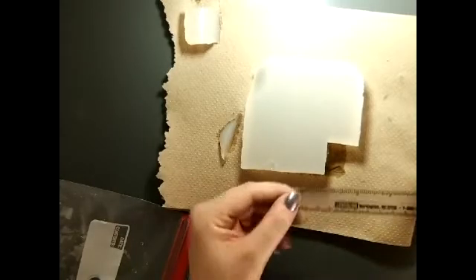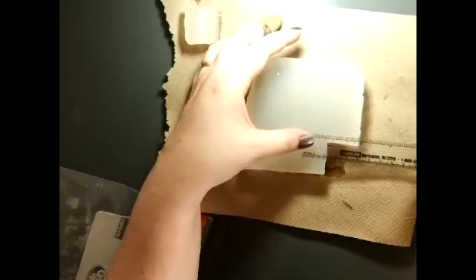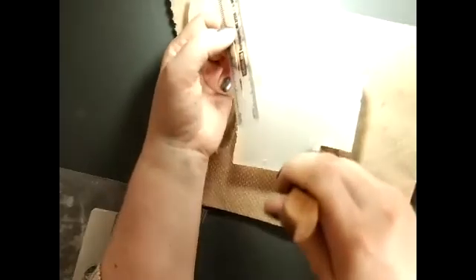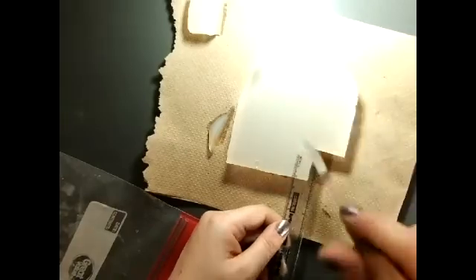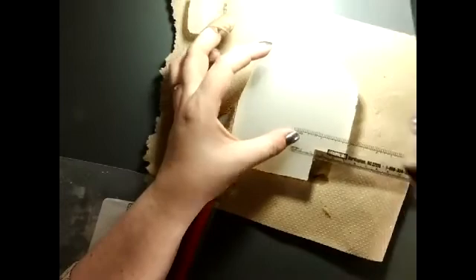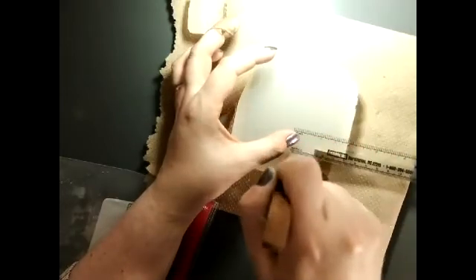And we're going to repeat for a 2 centimeter cube. Measure it this way going first. Okay, put a mark there. And then that's still 2. Go that far.